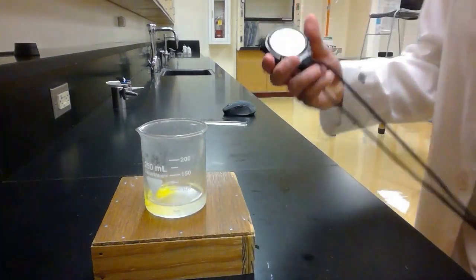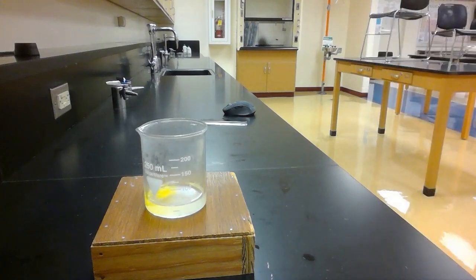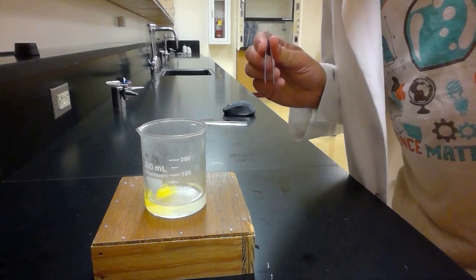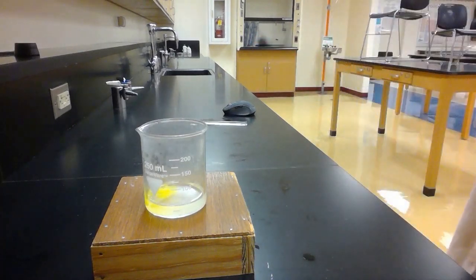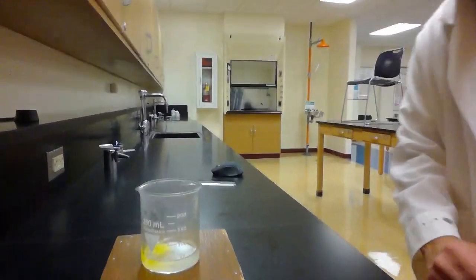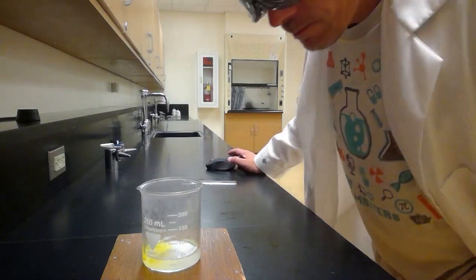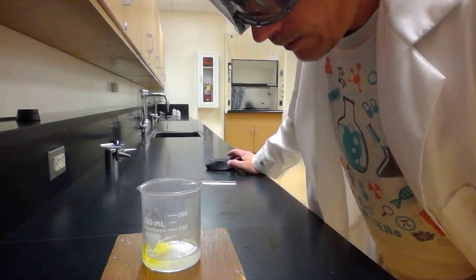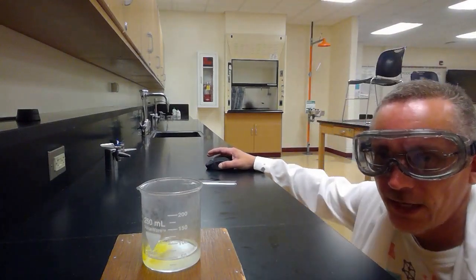Okay, we'll call that developed as about 6.5 minutes. Much longer than I expected it was going to be. And I'm not going to fish that out of there with my forceps because I'm afraid that the acid will react with the metal in my forceps. So I'll fish that out of there some other way. Yeah, it took a lot longer than I thought it was. It was room temperature concentrated hydrochloric acid.